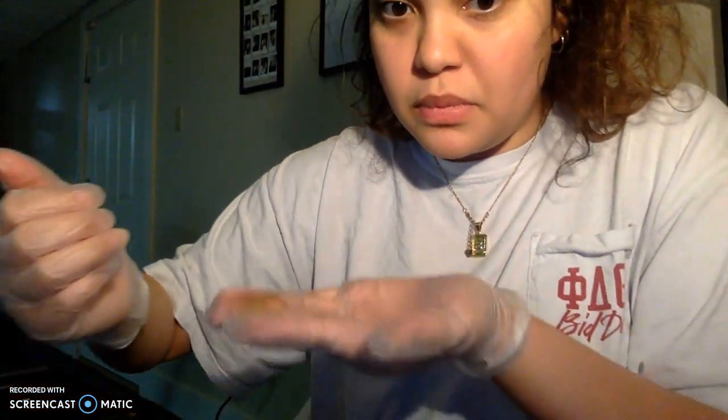So I will try to pick it up gently with my fingertips. I got some of the rubber mat on it, the particles on it, but this is not a good idea. Give me 1 second, let me tilt this over. Okay, so this is the iris.